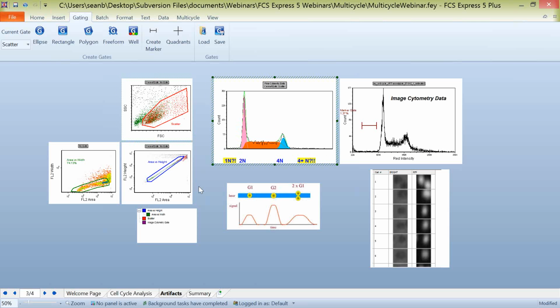If we take this a little further, and we have our area versus height gate, which is one of our singlets gates or doublet exclusion gates, as well as our area versus width gate, when we apply this gate to the plot, you'll now see that almost all of this 4n plus population, anything to the right of this blue G2 peak, has disappeared. What we did there was just exclude doublets from our analysis. Doublets are anything that's 2 or 3 or 4 or a whole bunch of cells stuck together. We do have this population down here on the left that's less than 2n. If we make our doublet exclusion gates a child of the scatter gate, that gets further reduced.